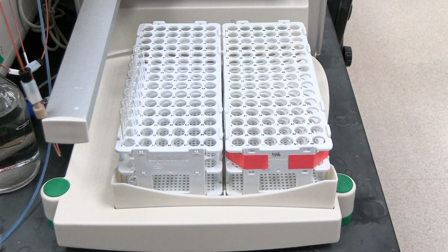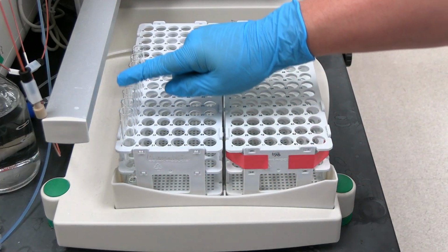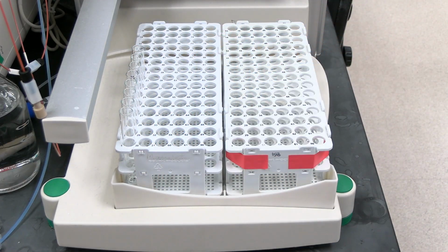Set up tubes in the fraction collector. Use the 90 tube racks and use the 13 by 100 mm test tubes. Rack A is on the left, Rack B is on the right. Position 1 is on the lower left corner. All the rack positions are numbered. The default tube fill path is serpentine.